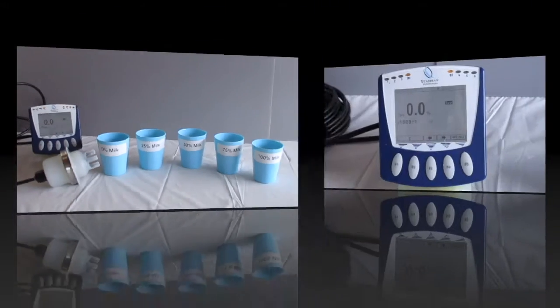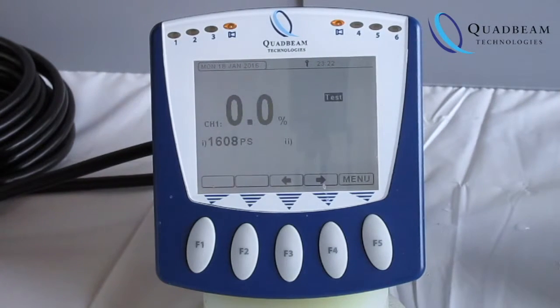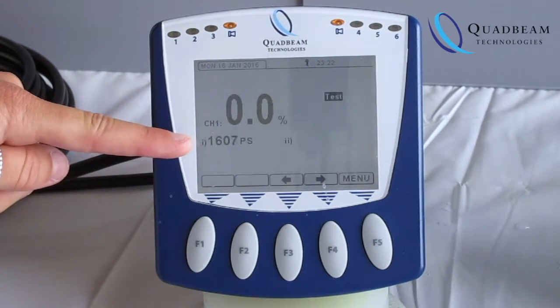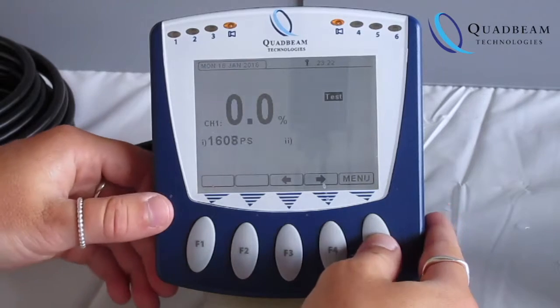In this case we're using MXD73 and an S20 sensor. You can see here the probe signal value, this is the raw data value that we're going to relate to.